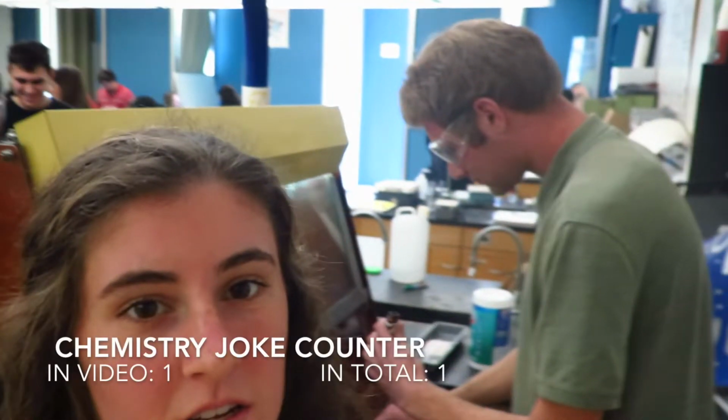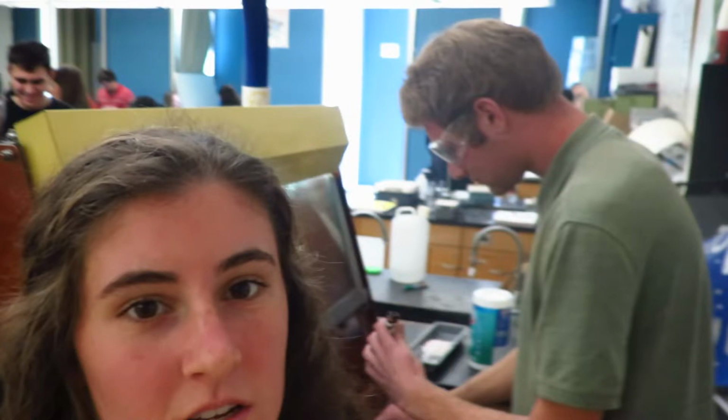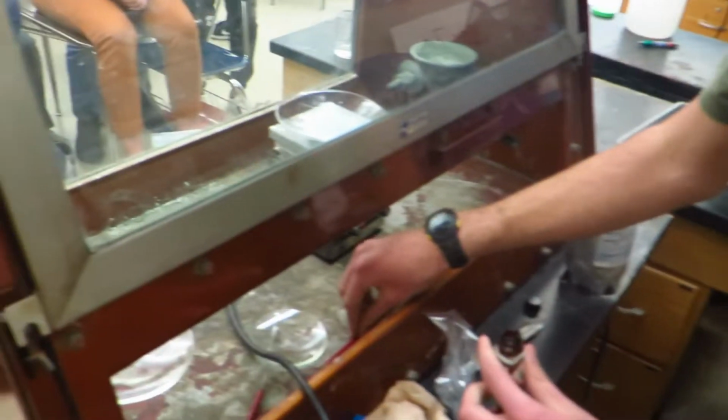And so this is Axel back in the lab. He's pretty much in his main element. Here we go. Axel, any words?